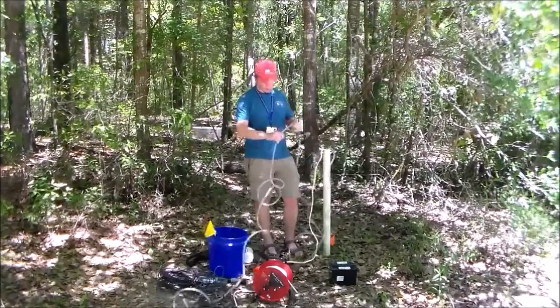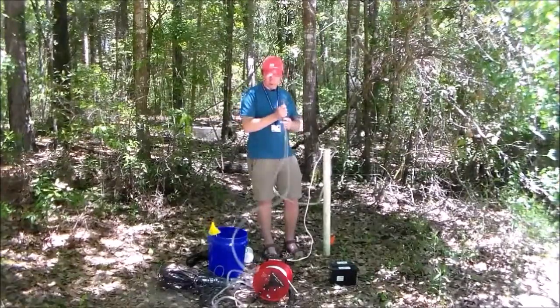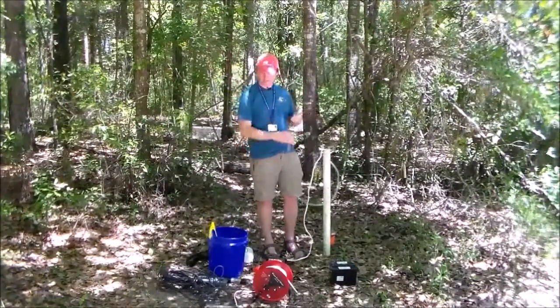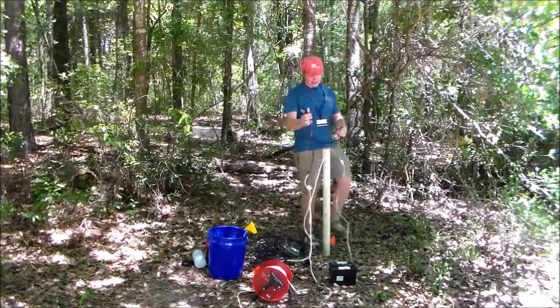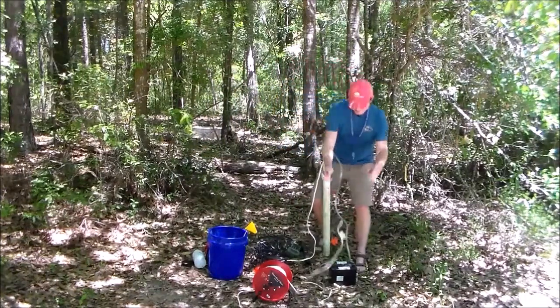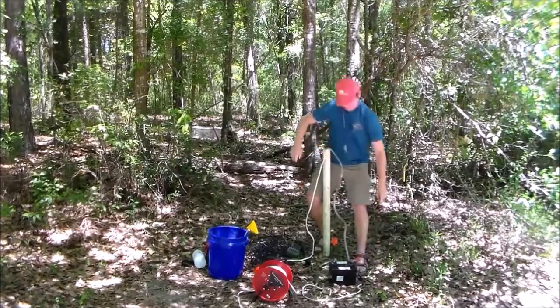Okay. So I got my hose. Actually got way too much hose here, so I can pull this apart. It'll be nice and easy. Okay, so that's all set up. Getting our sample is all set up. So I've got my alligator clips here. Negative up first, positive. And here we go.